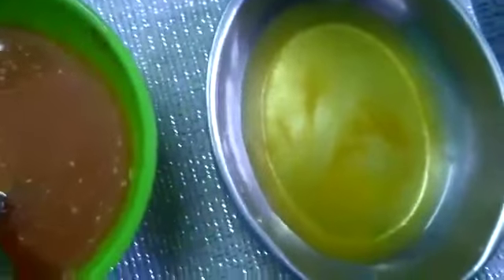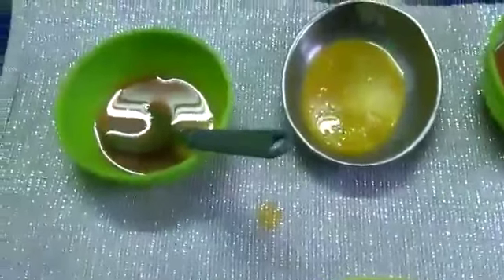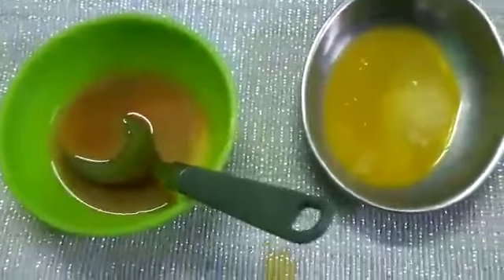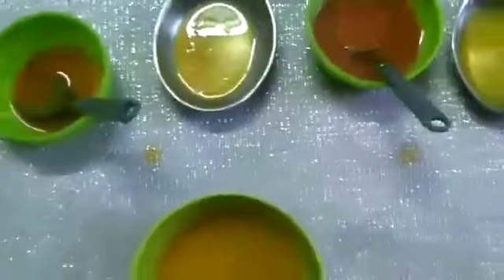The vinegar didn't change any color, so this is an acid. From this, we get that a natural indicator like turmeric can show us whether substances are base or acid. Thank you.